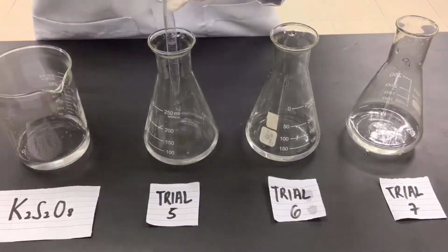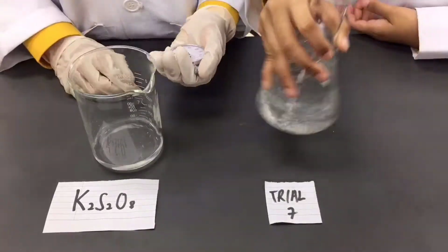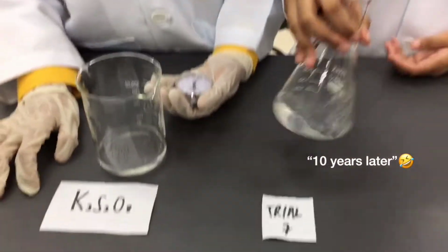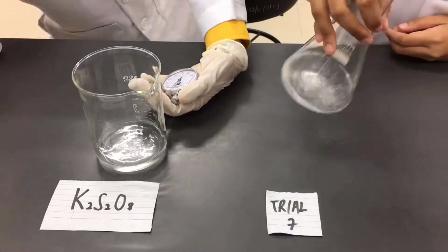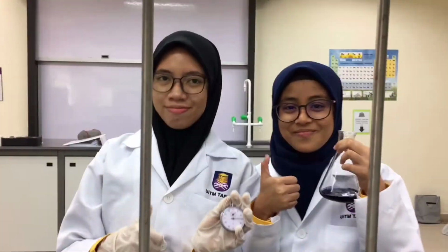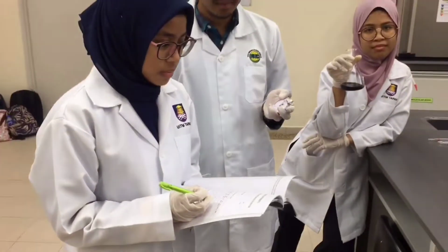Then we proceed with trials 5, 6 and 7. This time, use a constant volume of iodide and different volumes of potassium peroxydisulfate. The time for each trial was then recorded.